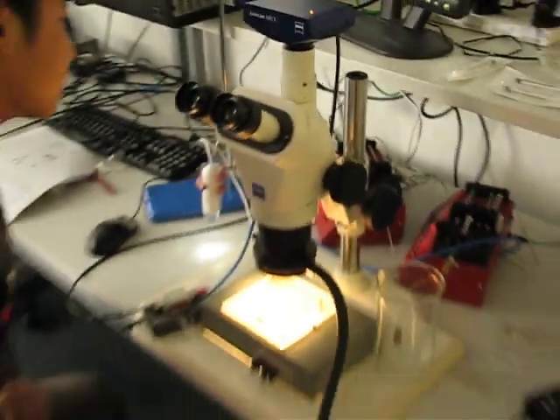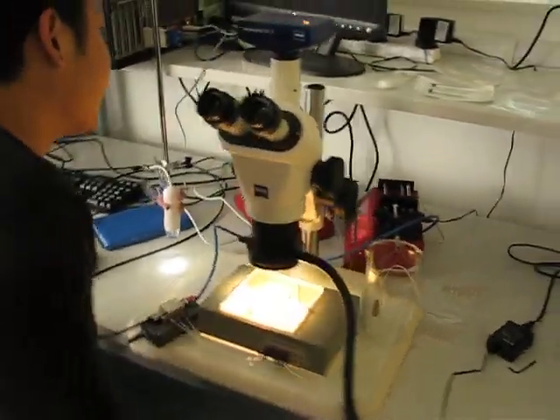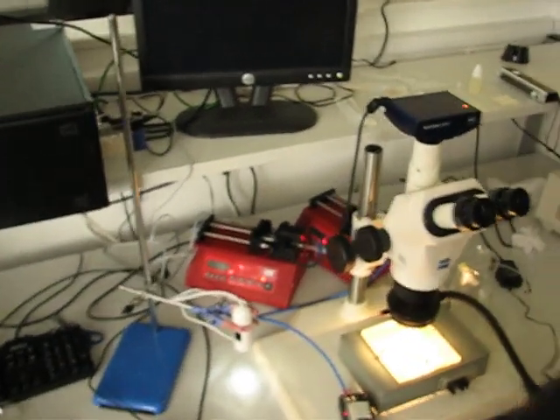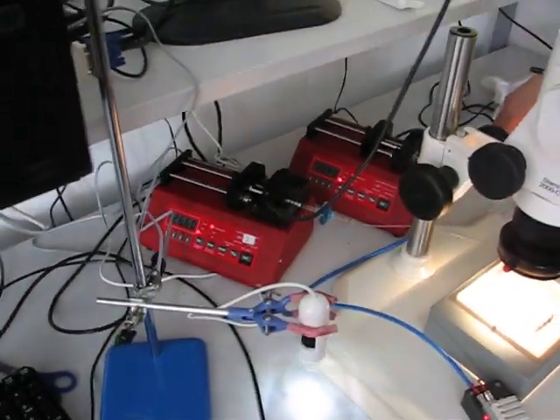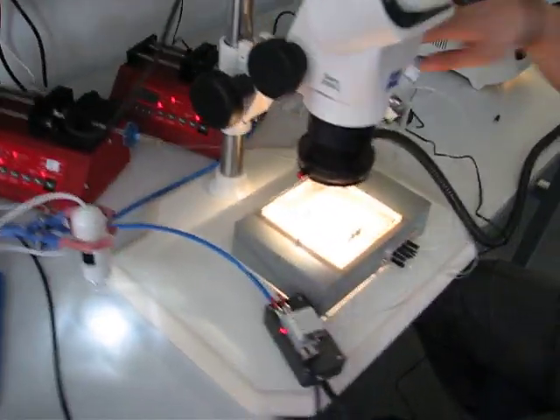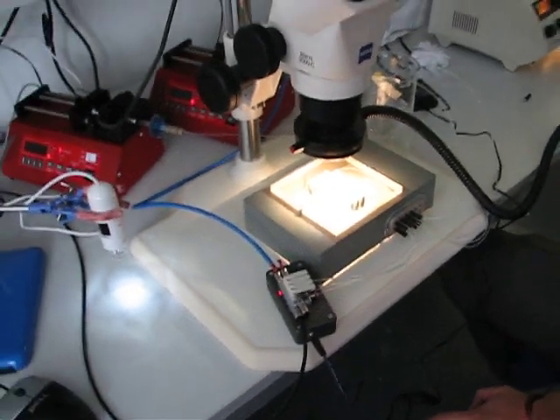You can move back to our platform here. We have two pumps. Precisely control the flow rate of water and oil. And these pumps inject the fluid into this platform here.